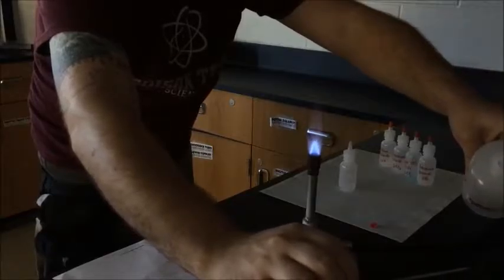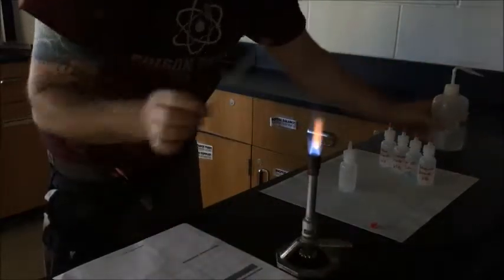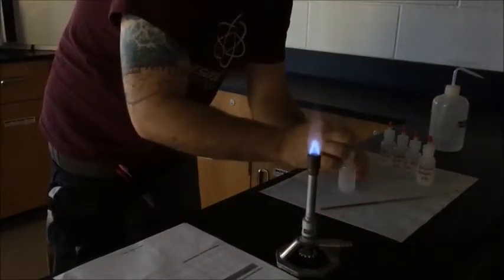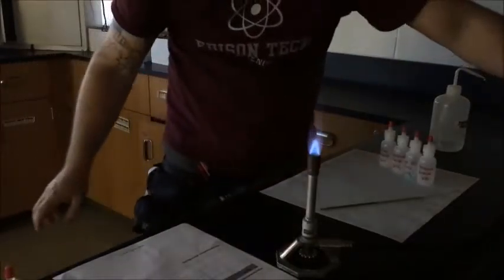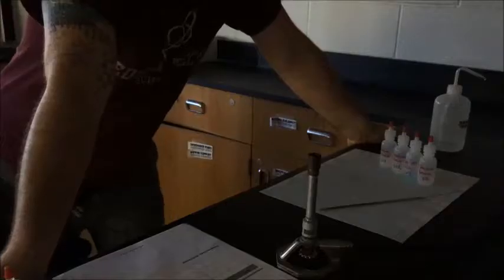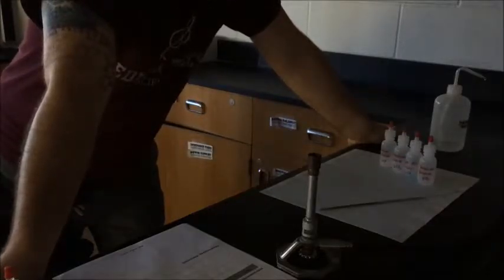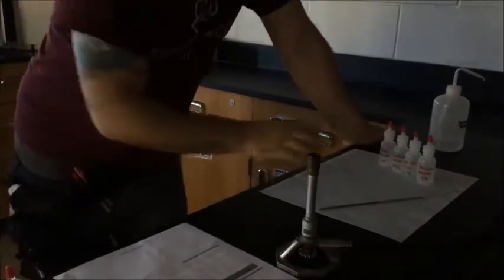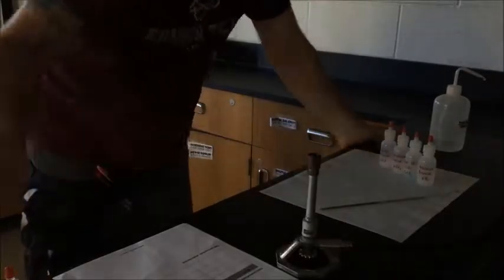To clean up, rinse your loop. Put it back on the table, cap your chemicals, turn off the gas, and let somebody else have the chemicals to do their samples. So again, remember, you're testing one, two, three, four known chemicals and then three unknowns. No tricks.